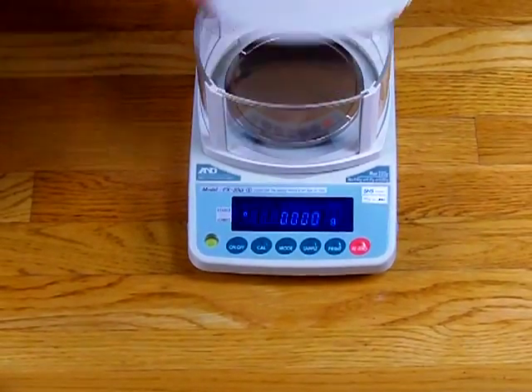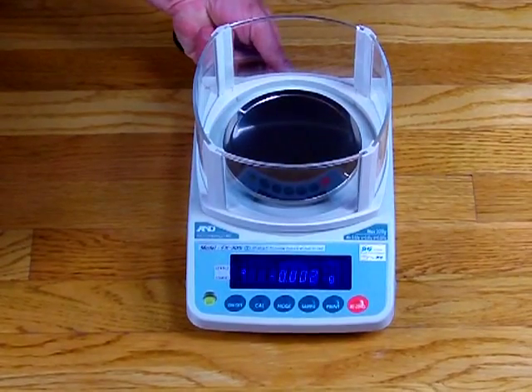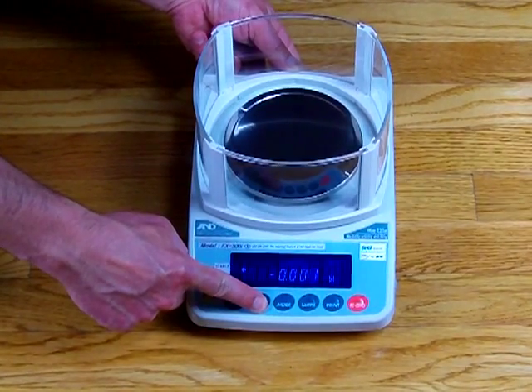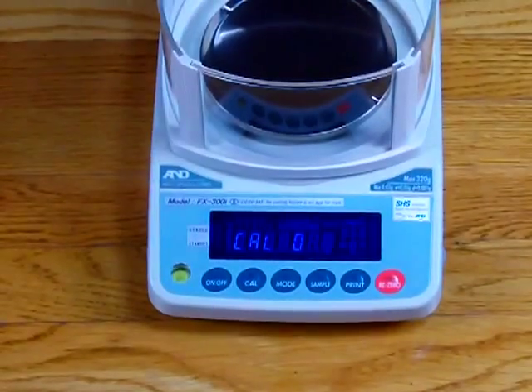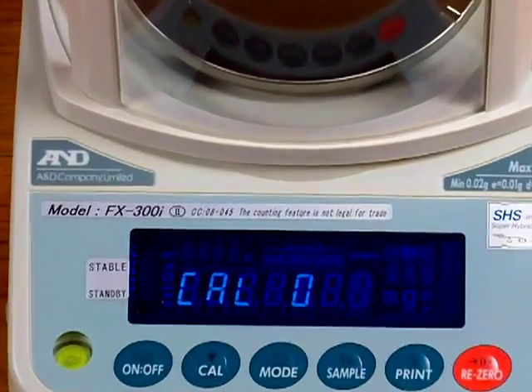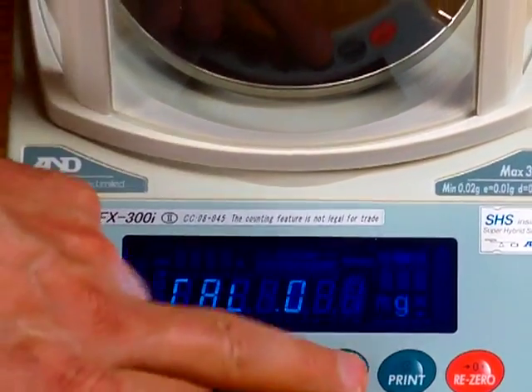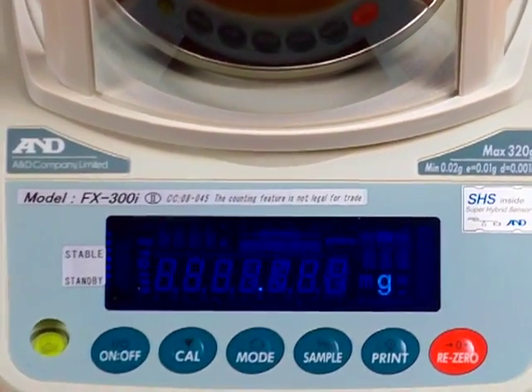On the back of the balance, I'm going to press that button hidden underneath. While holding it, you'll hear a little beep — press the CAL button at the same time. You'll notice it went to 'CAL out' and then 'CAL zero.' Simply to start the calibration, you are now at CAL zero. Press the SAMPLE key and it will flash '100.'